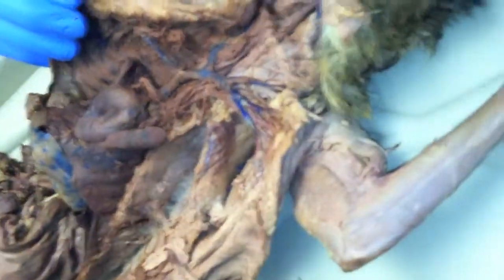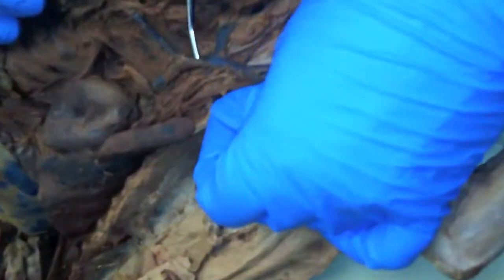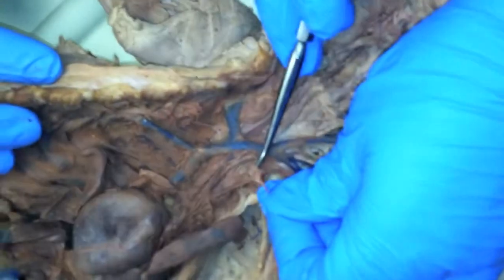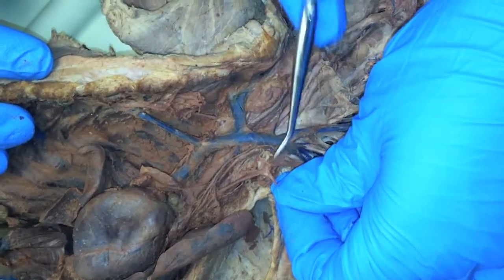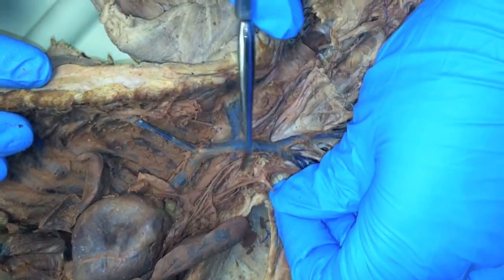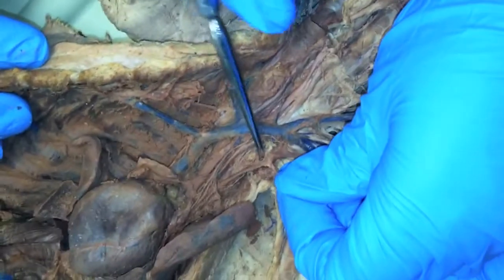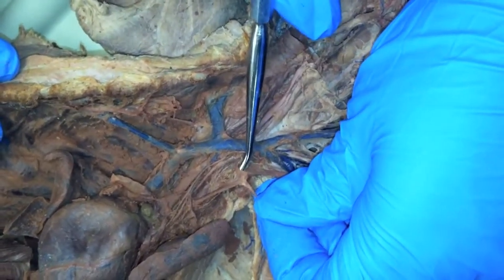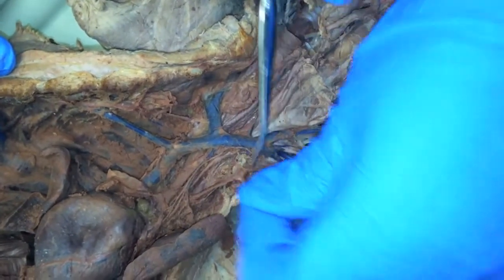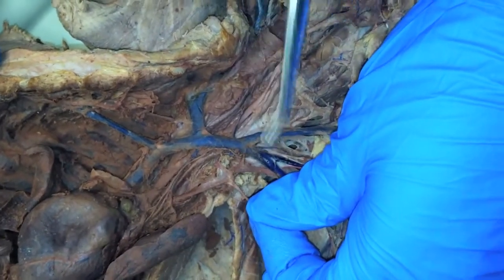There must be another one here. Looks like right here. It's running right across the bone, kind of running right over the bone here. What one is that? This one back here is vertebral. This is costo-cervical. I'm holding the internal mammary, and then that's your thyrocervical.